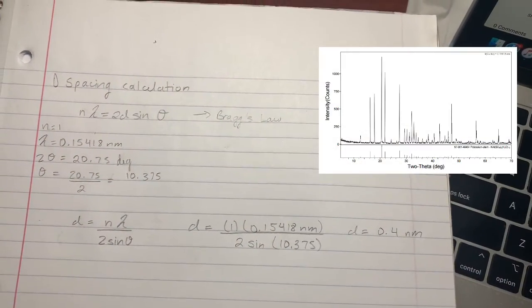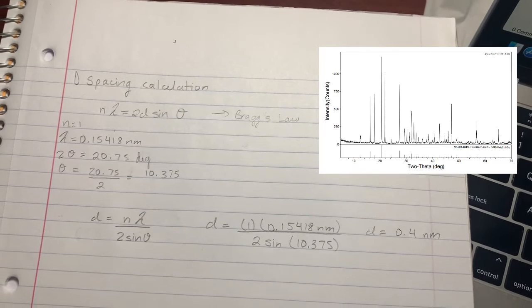A given unknown crystal is expected to have many rational planes of atoms in its structure. Therefore, the collection of reflections of all the planes can be used to uniquely identify an unknown crystal. In general, crystals with high symmetry, like an isometric system, tend to have relatively few atomic planes, whereas crystals with low symmetry in the triclinic or monoclinic systems tend to have a large number of possible atomic planes in their structures. To calculate the d-spacing for the largest peak on the graph, we would need to use Bragg's law.